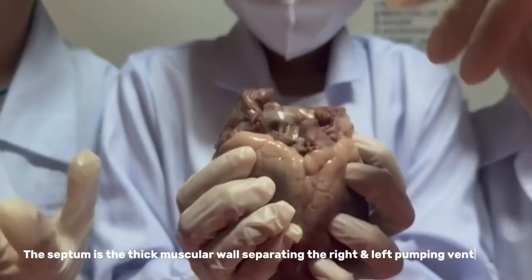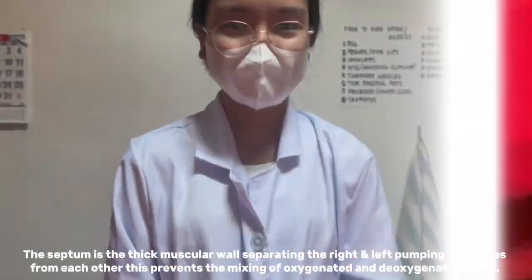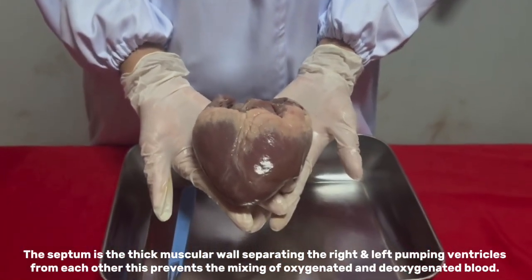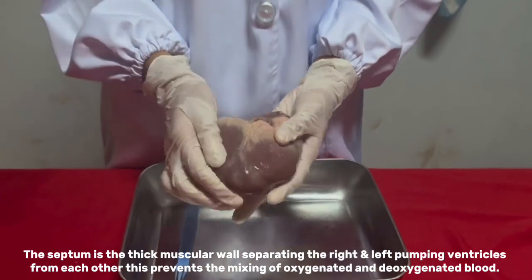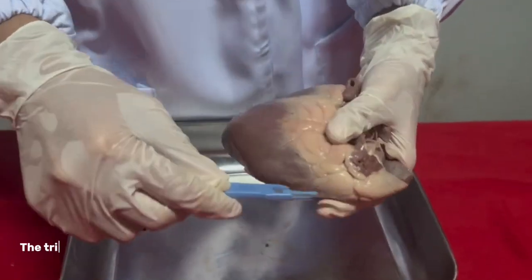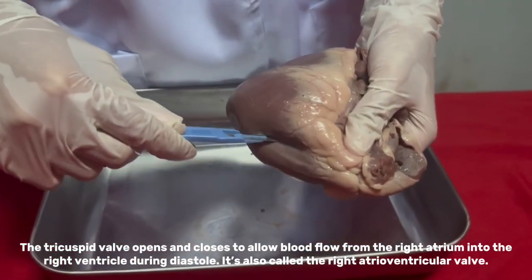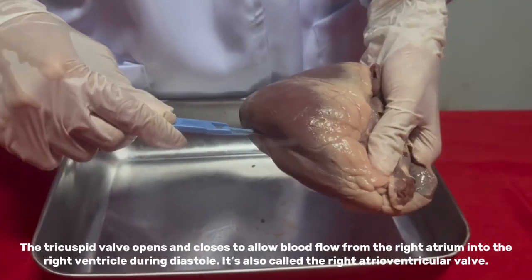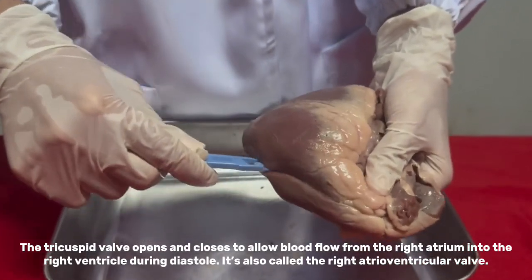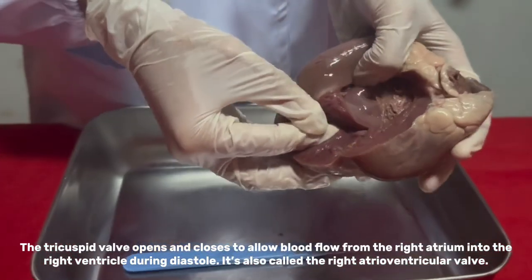The septum is a thick muscular wall separating the right and left pumping ventricles from each other, and this prevents the mixing of oxygenated and deoxygenated blood. The tricuspid valve opens and closes to allow blood flow from the right atrium into the right ventricle during diastole. It's also called the right atrioventricular valve.